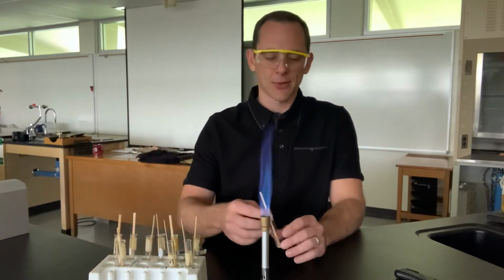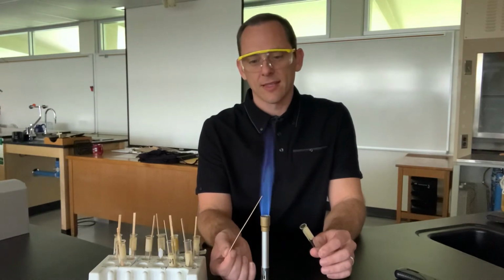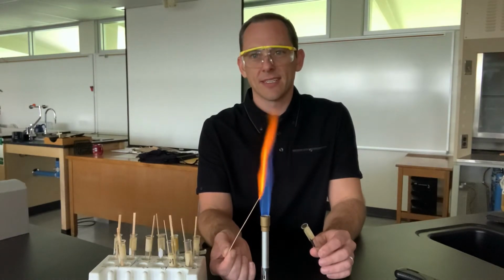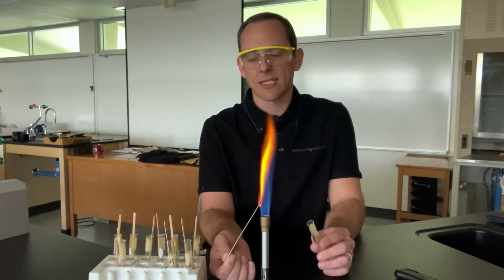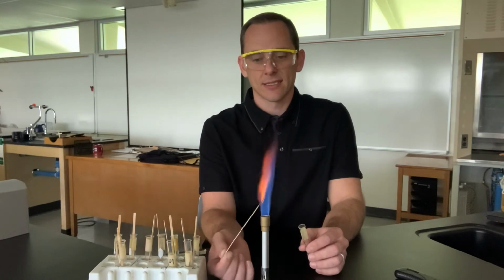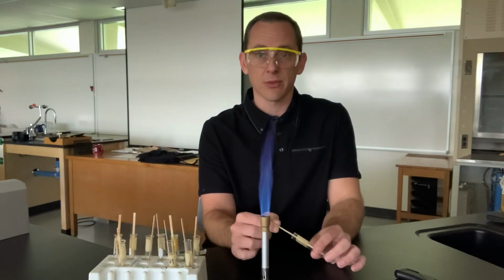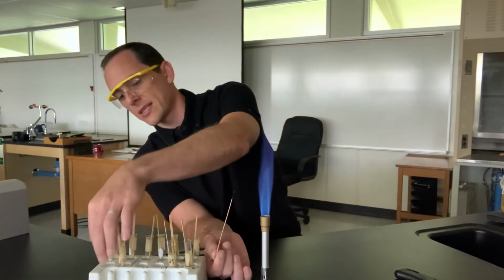Oh, this one's a tough one. Calcium. Different. Some of you are like, wait a minute, what? That looked exactly like the last one. No, it's different. Okay, this one's darker when you look at it from the last one. Here, I'll put them in side by side. Let's do this.